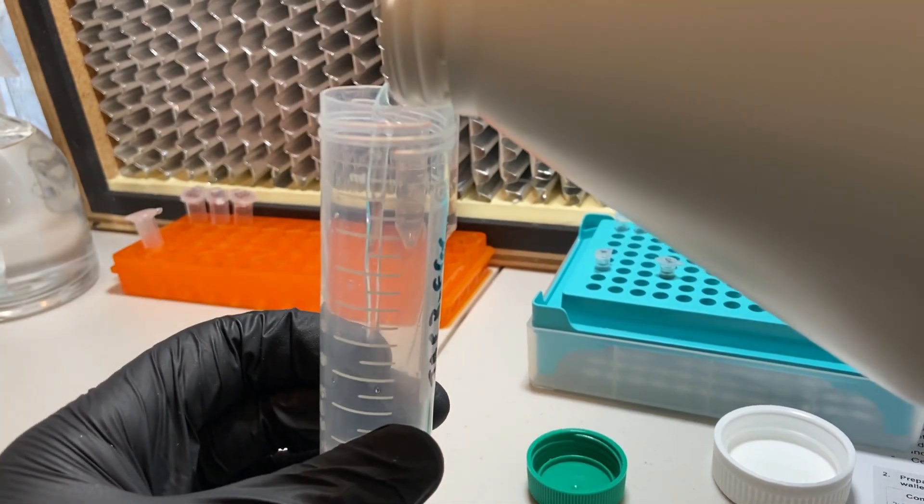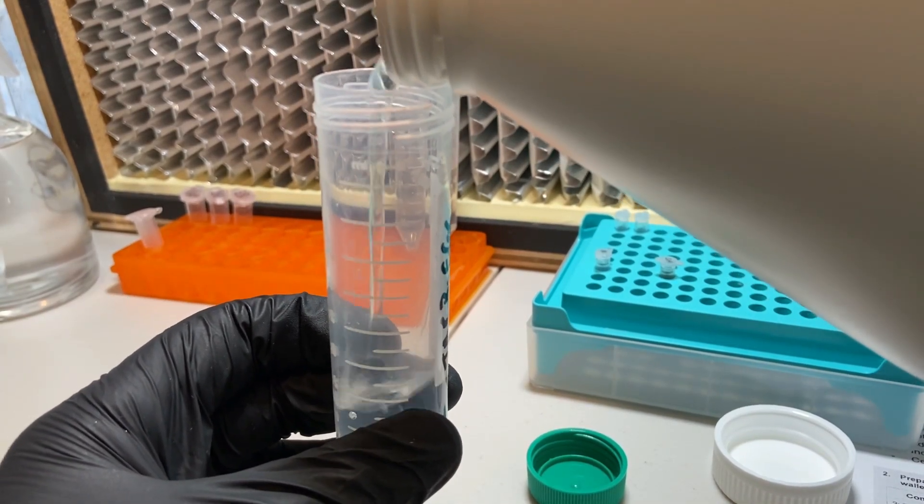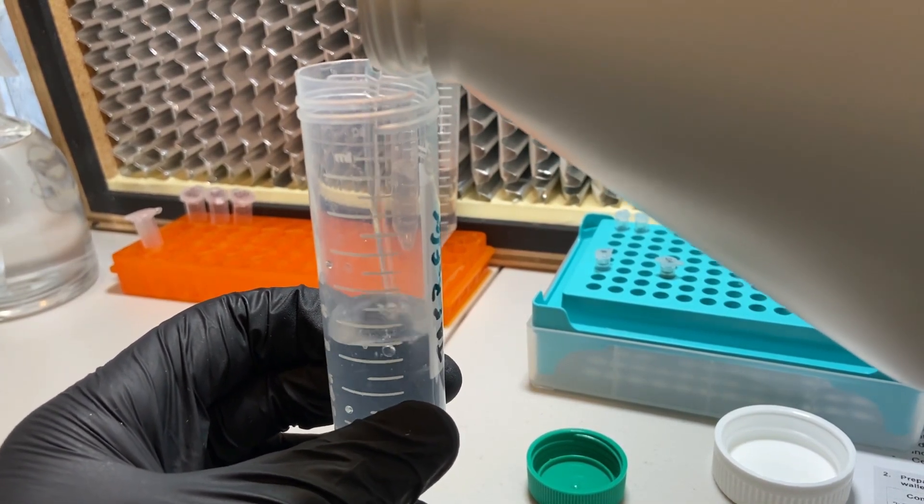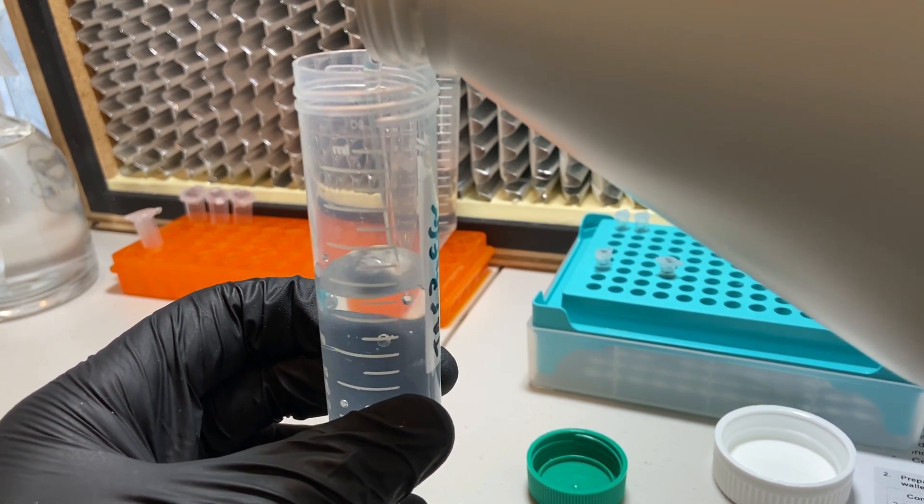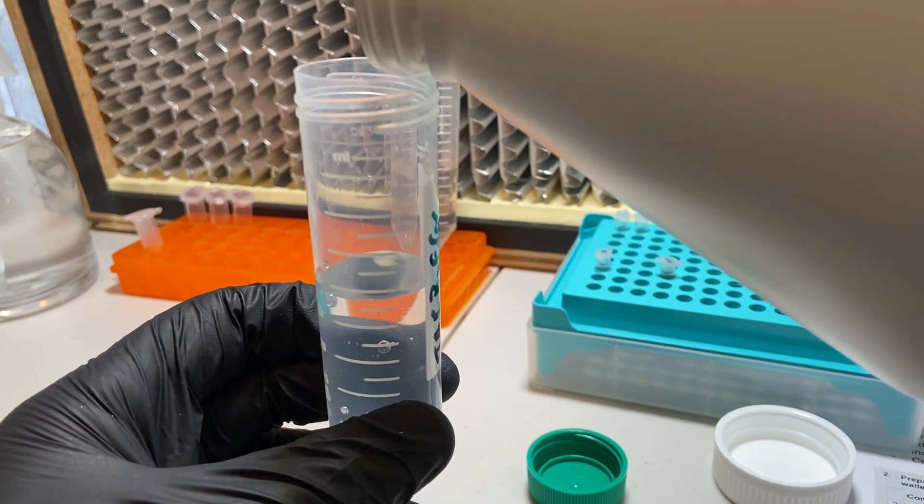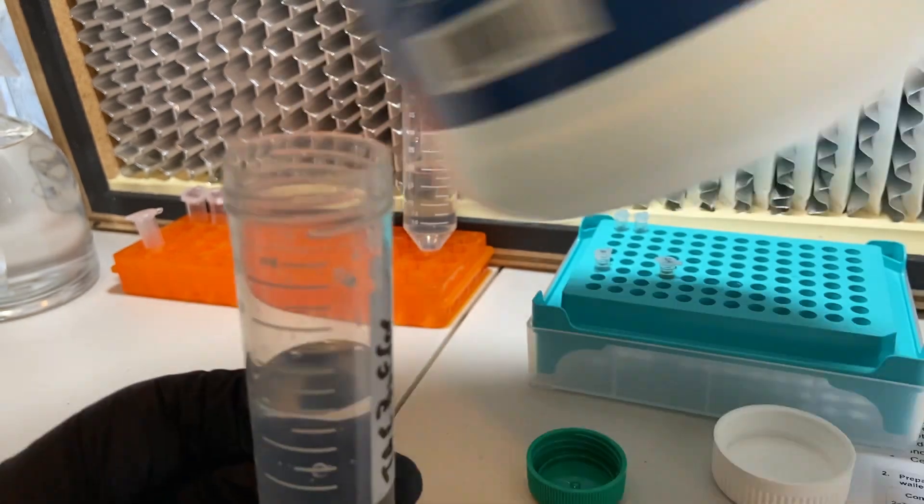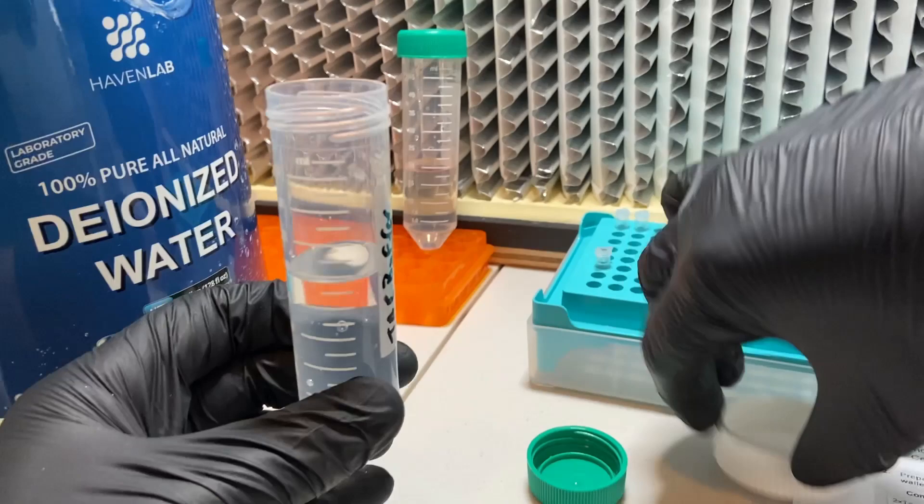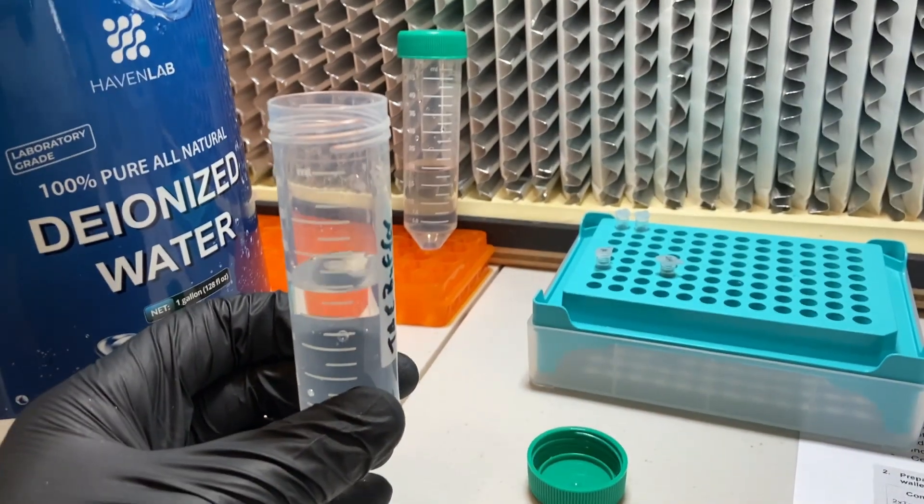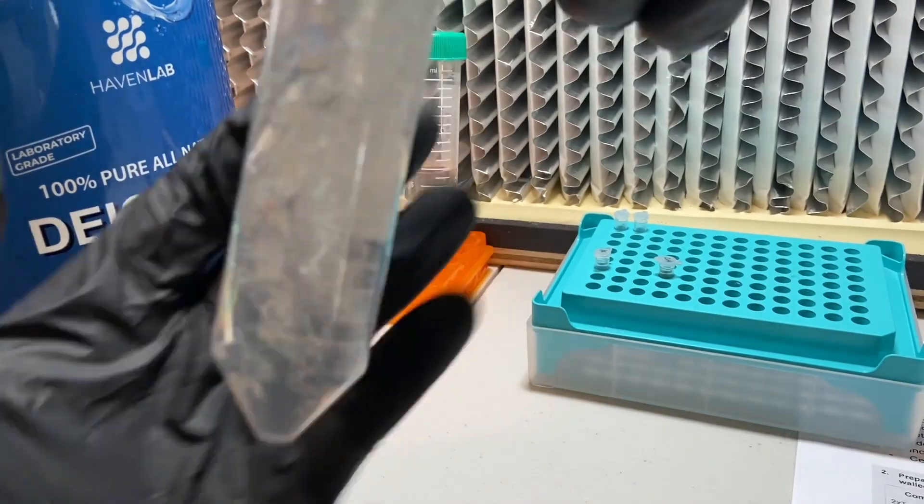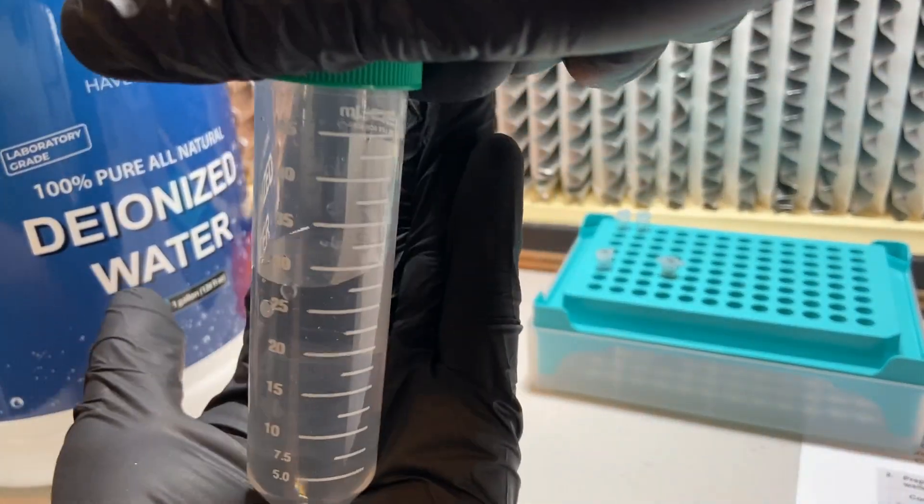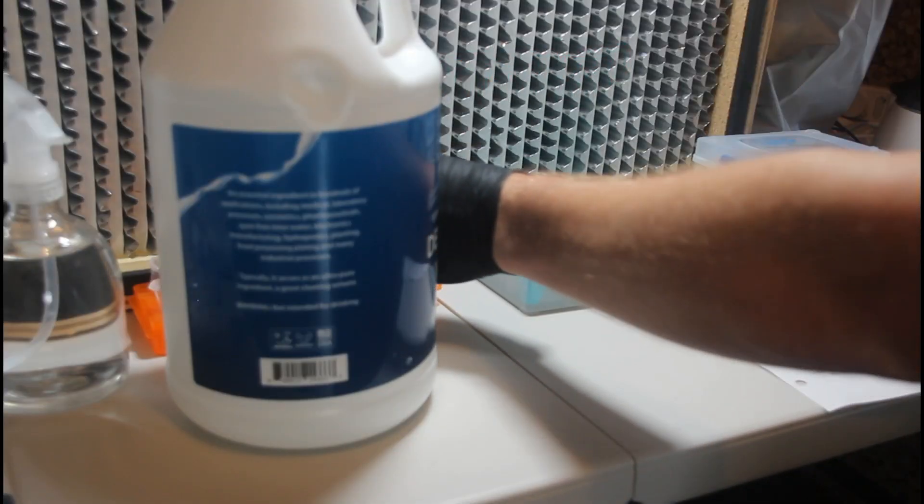If not, you'll have some issues in running your gel, it just won't work, or even your PCR reaction could fail. So just something to keep in mind, and it's something that has bit me a couple of times, and it's not something that I would have thought of when I was going through the process and trying to troubleshoot the many PCR and gel failures that I had when I was learning this stuff. So go ahead and mix everything really well.